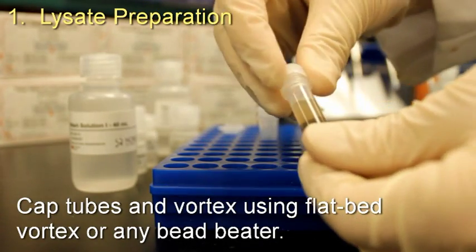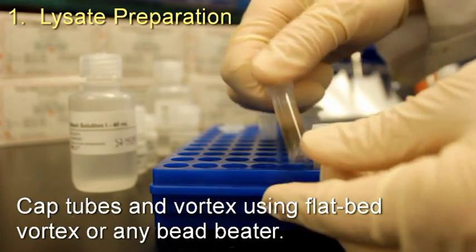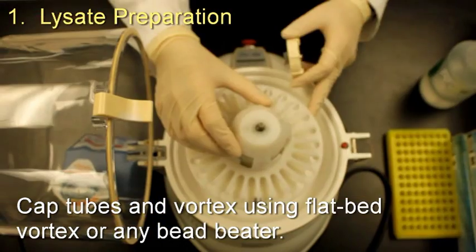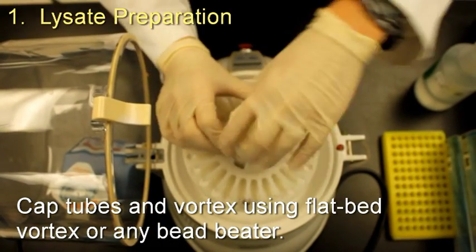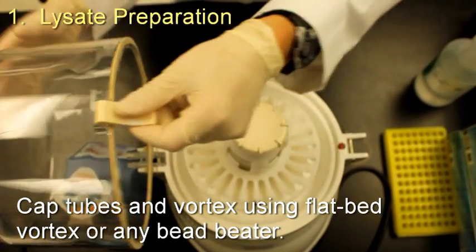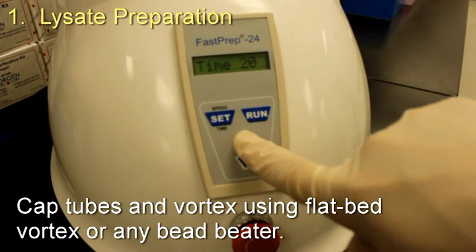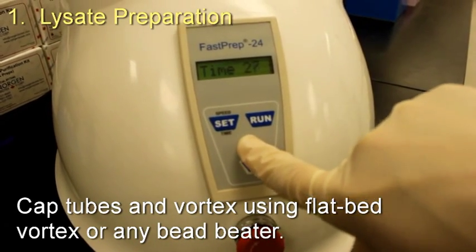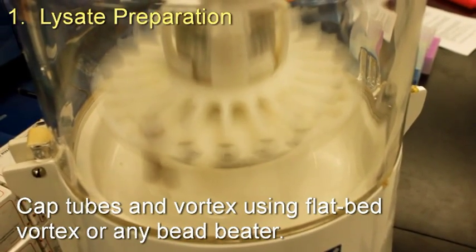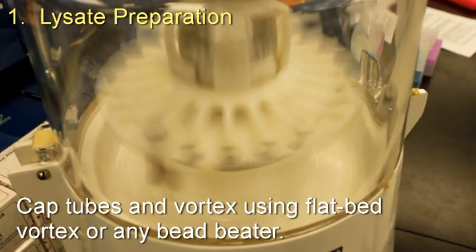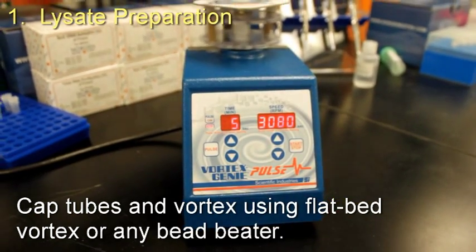Cap tubes and vortex using a flatbed vortex or any bead beater system. Our protocol includes recommended settings for the MP Biomedical's fast prep instrument, or alternately you may optimize the time and speed according to the manufacturer's recommendations.